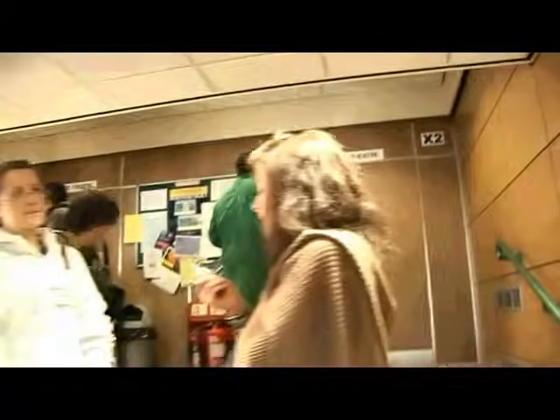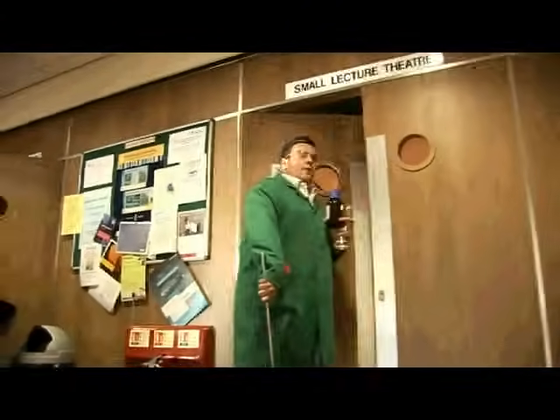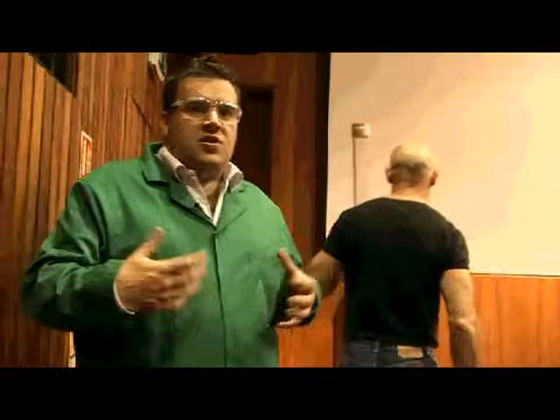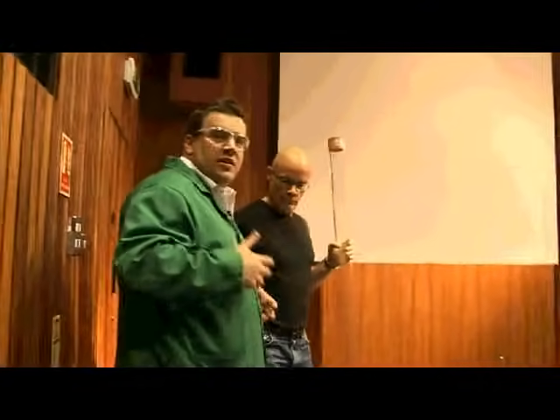So we're on the hunt for a very dark place. In the tube, as the reaction takes place, it generates heat. So we're coming to the small lecture theatre, which is vacant now. It's quite nice because we can turn all the lights off and make it a bit darker so you can see this reaction at its best.